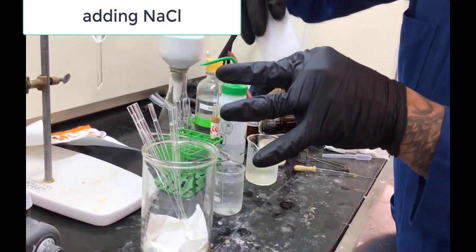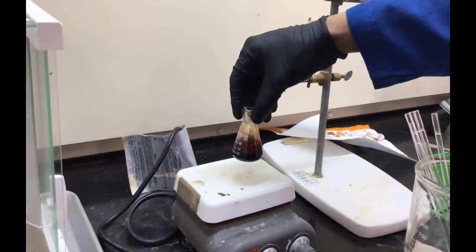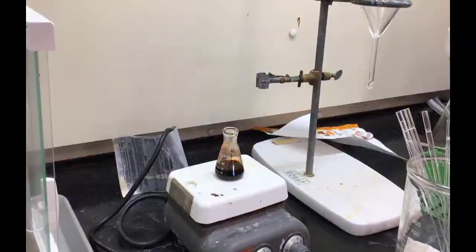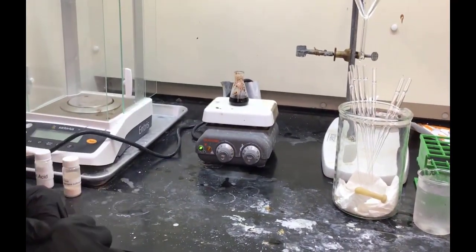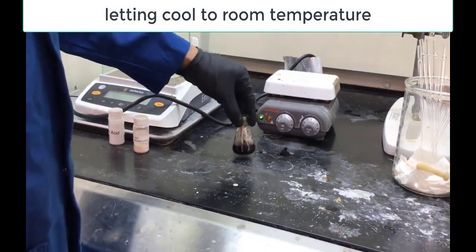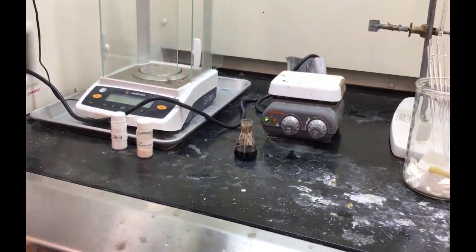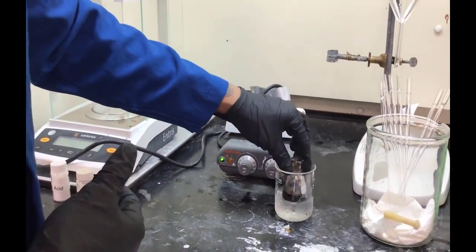Now they add the sodium chloride to the dissolved azo compound solution, and they are putting it back on the hot plate to help it dissolve further. All right, and now at this point it is heated long enough that they're going to let it cool to room temperature, so they're just taking it off the hot plate to cool. And then next we're going to see the cooled solution. Right now they're putting it in an ice bath.